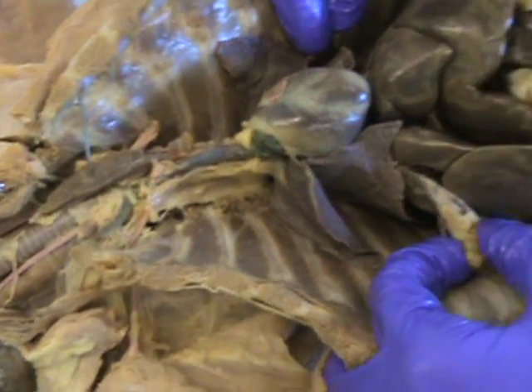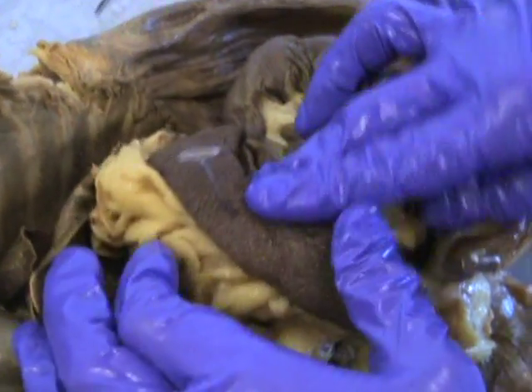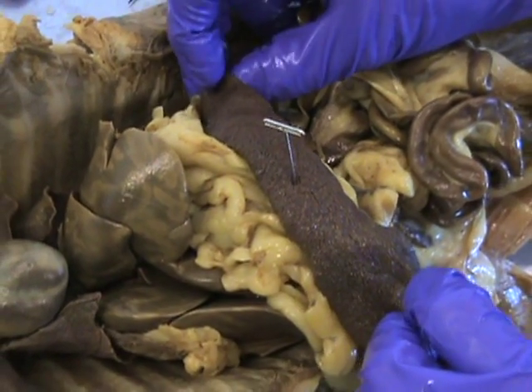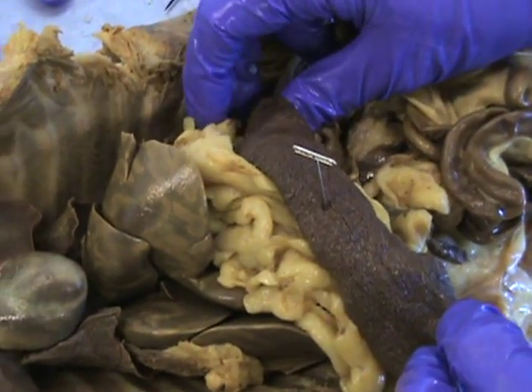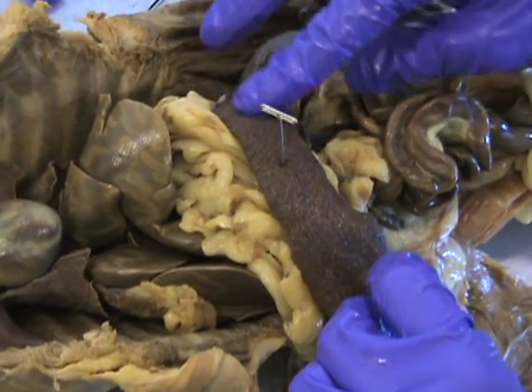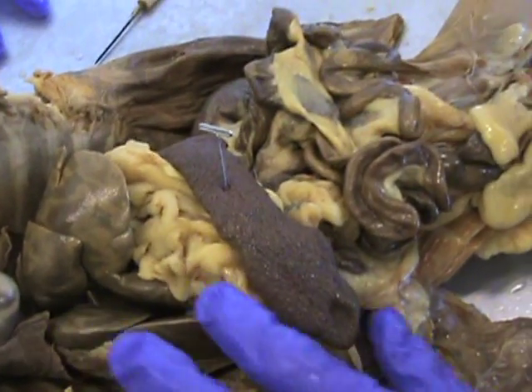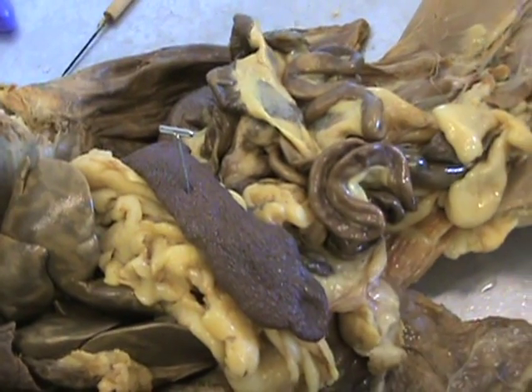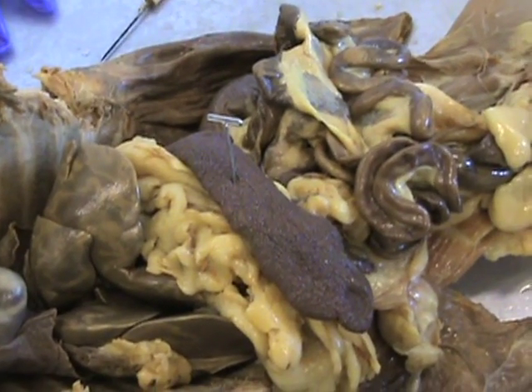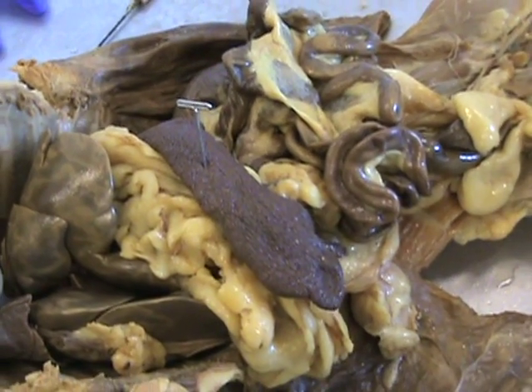Next is the spleen. We're going to move farther down into the cat — it's the thing that looks like a really wrinkly sack, or really bad elbow skin. That's the spleen. Its function is to remove old and damaged blood cells from the bloodstream. That's why it looks so nice and kind of gritty.